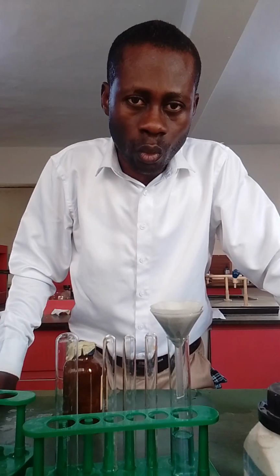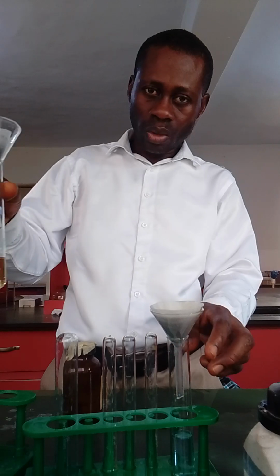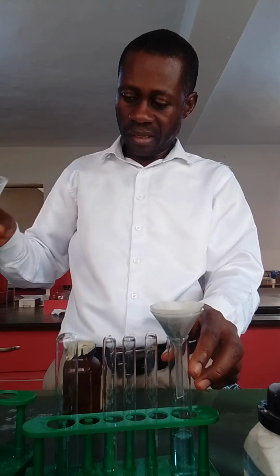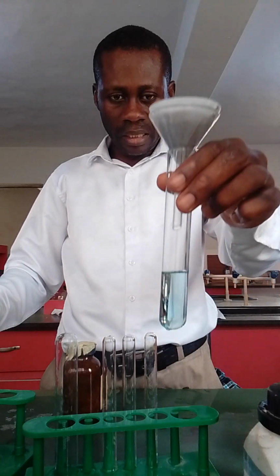We are still on this FCT ERC mock exams. In the last video, I gave you the analysis, and I told you that I would go ahead to make some research and possibly come with questions. I've done that, and we are here. I want you to check something. This was what we did the last time, which has a pale yellow filtrate, and this other one has a colorless filtrate.